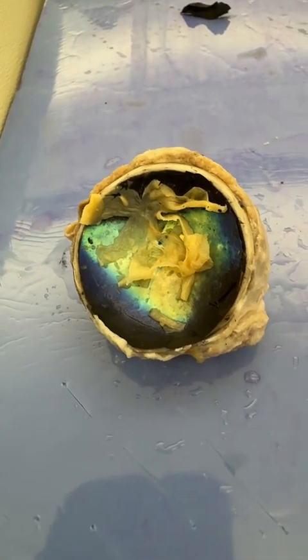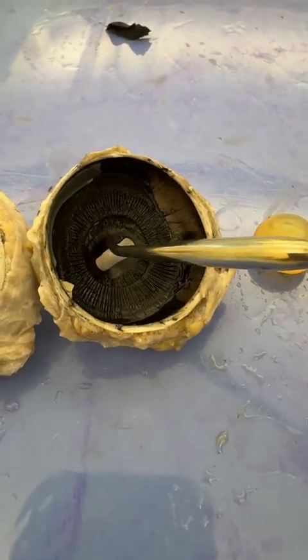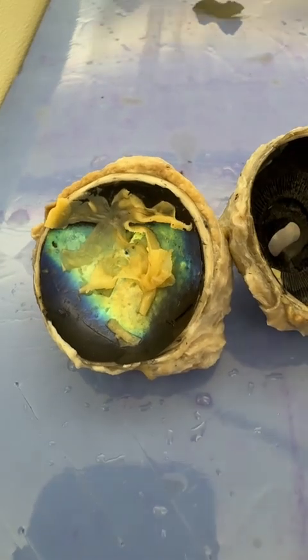So recap, the front of your eye, you have the cornea, the clear part, the pupil, the iris, the ciliary body, the lens, the sclera, the choroid, the back there, the retina, and the tapetum lucidum.